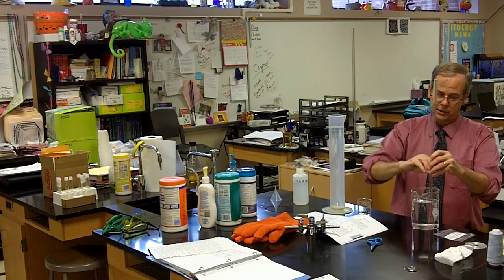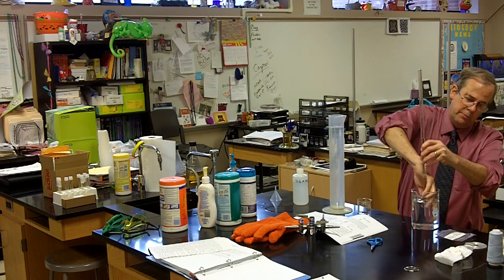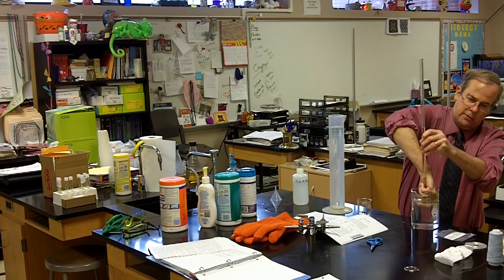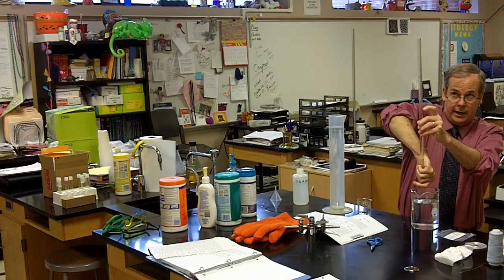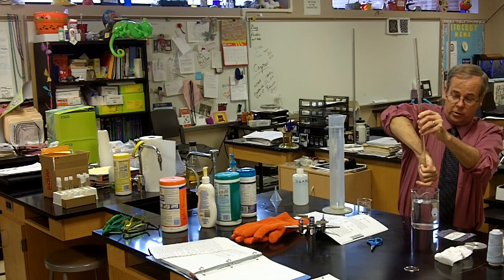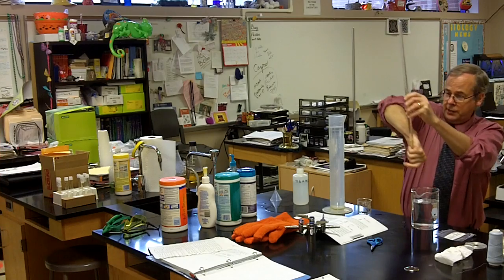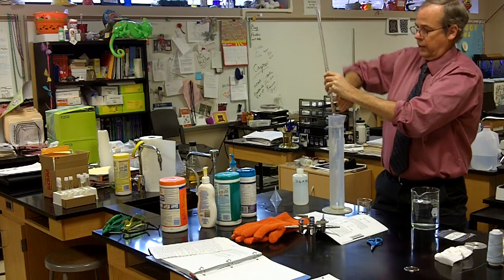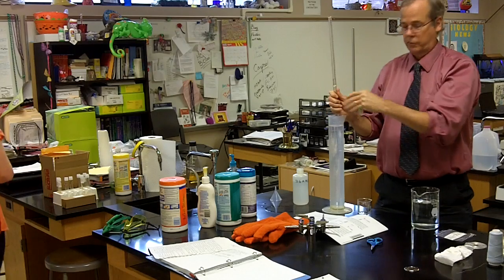So here's what I do. First, I lift the tube up, place my thumb over the tube end so that nothing gets in or out. There's no air added. I still just have hydrogen and water vapor. Then I lift up and place it down inside a graduated cylinder that is filled with water.